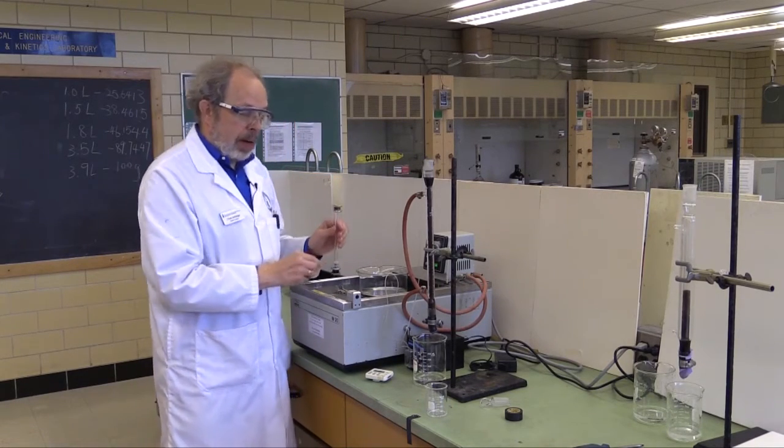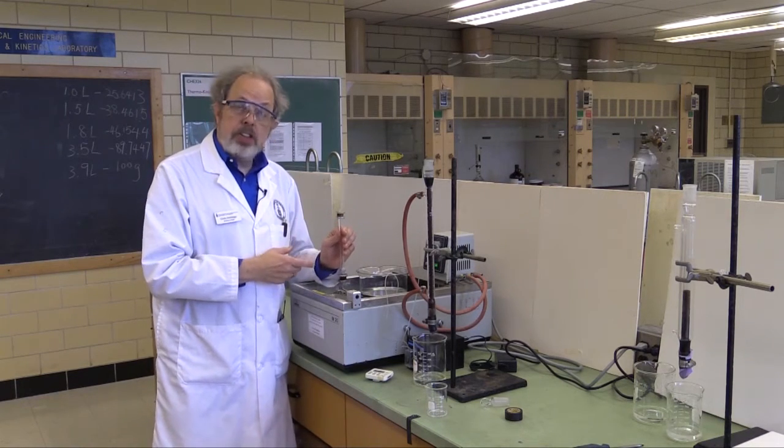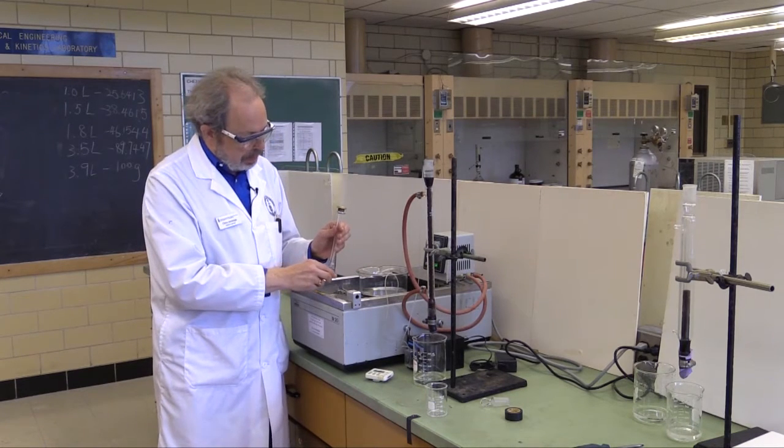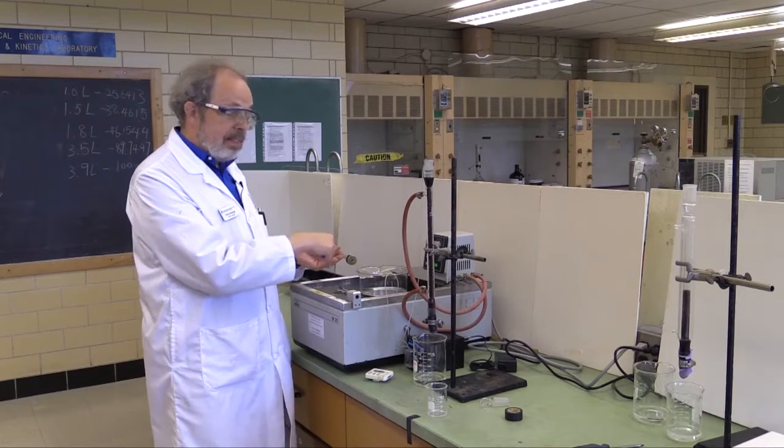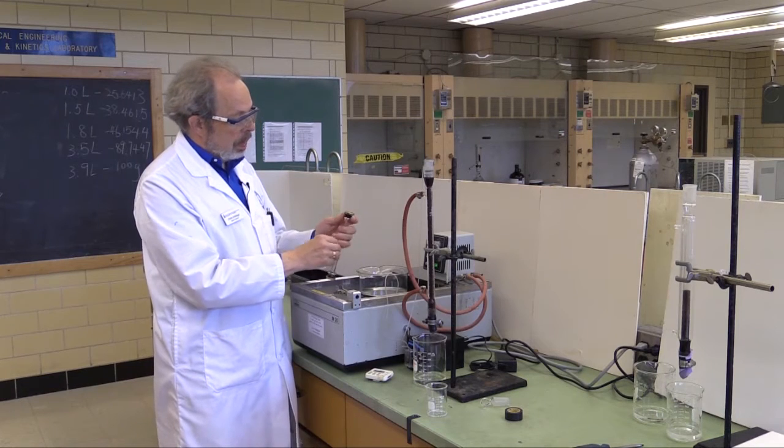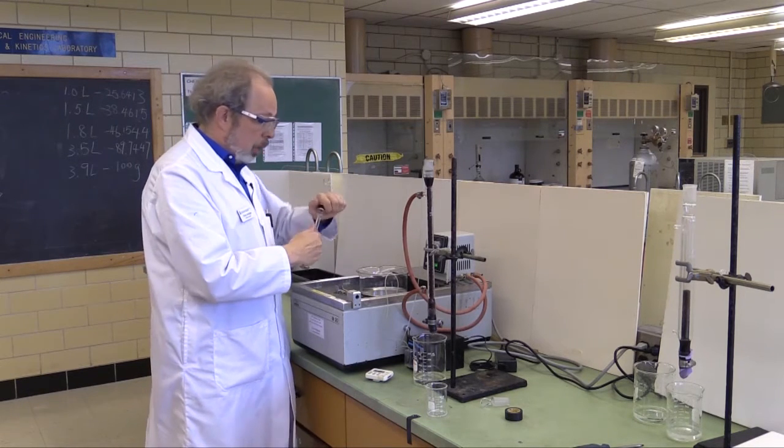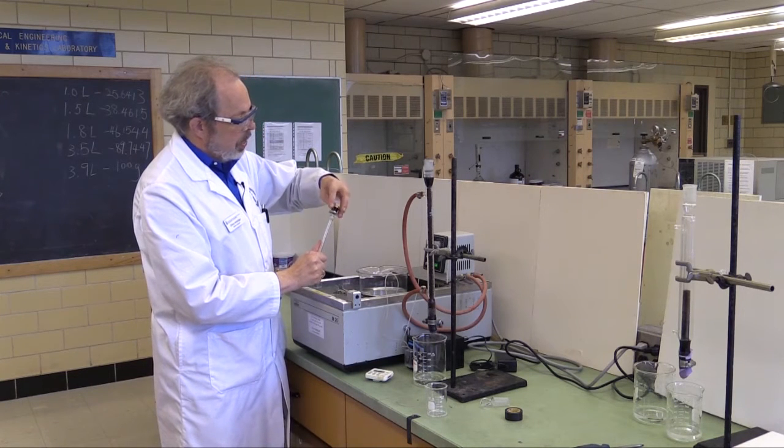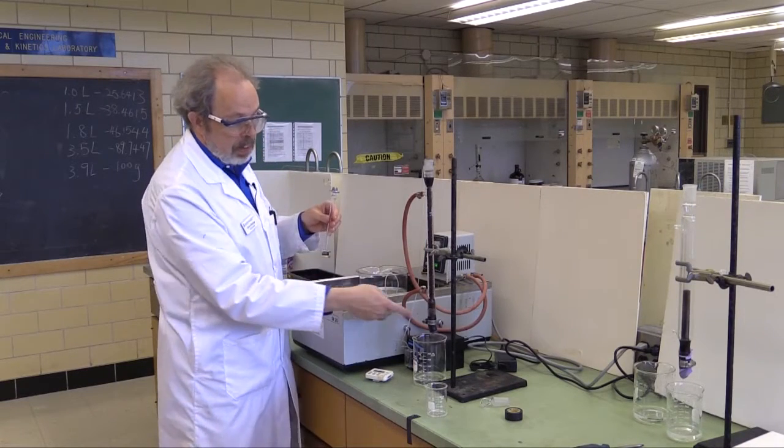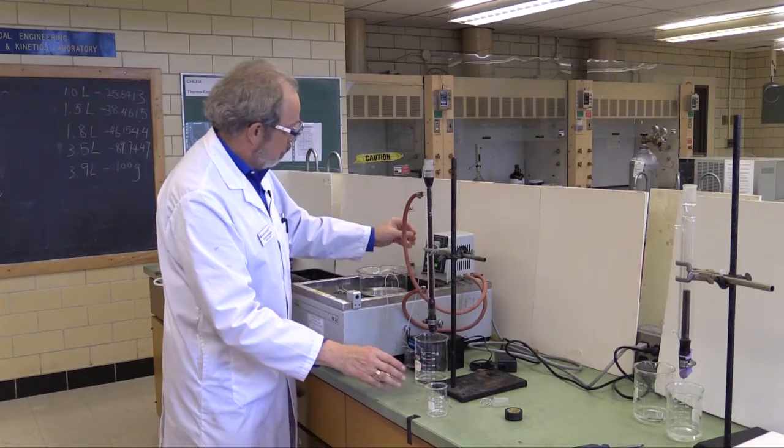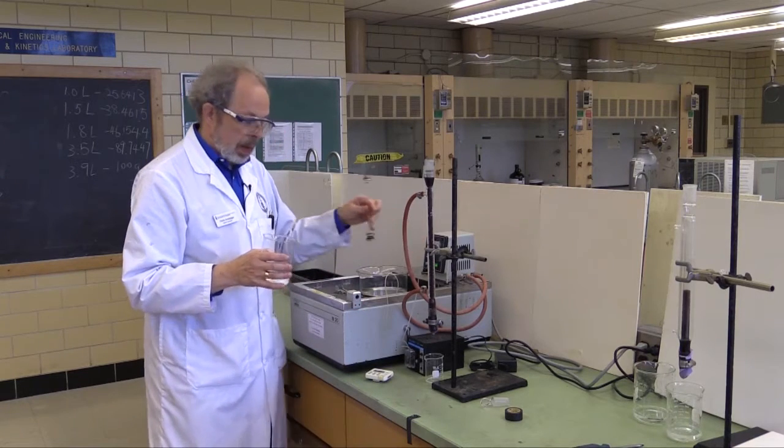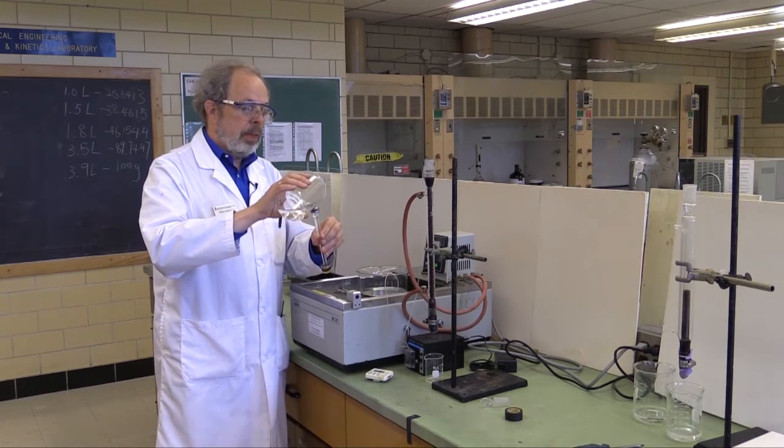Optical rotation, it turns out, is a function of temperature. So, you need to read it at 60 degrees, because that's what the temperature of this is. So, keep the cell inside the hot water bath, and only fish it out when you're just about ready to go. It holds about 10 mils of liquid. Now, it will be warm, but not uncomfortably so, when you take it out. Towards the end, once you've got about 10 mils, and I should have changed this, stand that up, trade this so that we've got something happening, and fill the reactor.